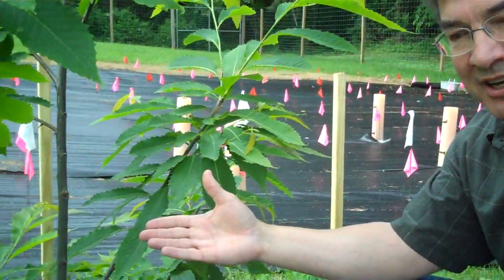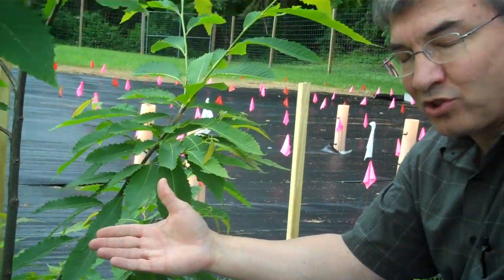What we're doing is inoculating a stem that's about one centimeter or larger in size — probably one centimeter to 1.2 centimeters. The idea is to inoculate it in a way that's very consistent from tree to tree so we can make comparisons easily.